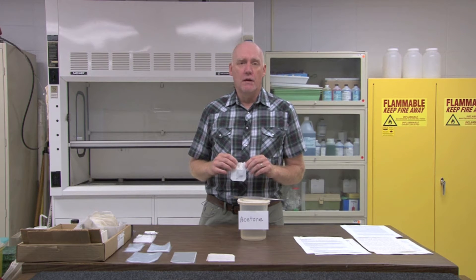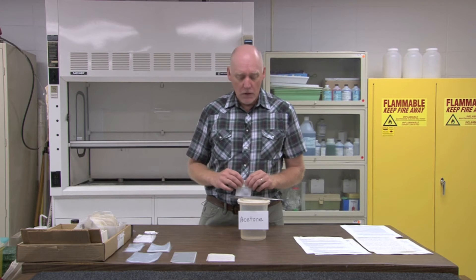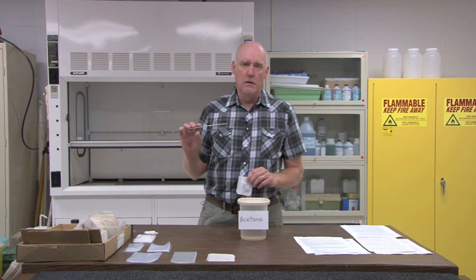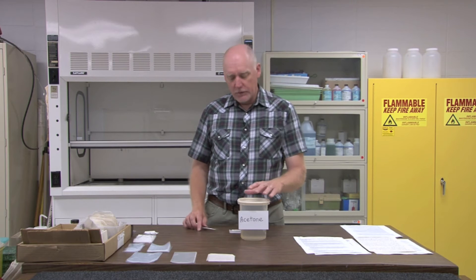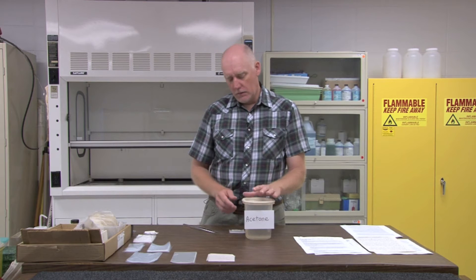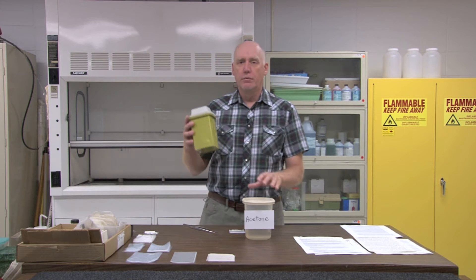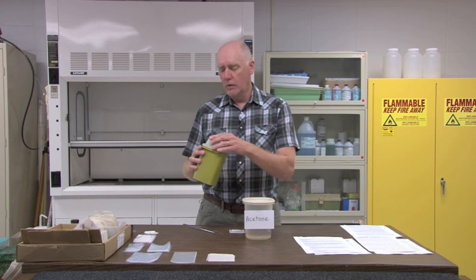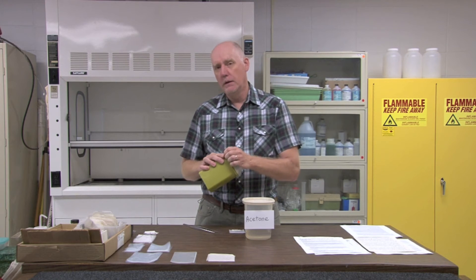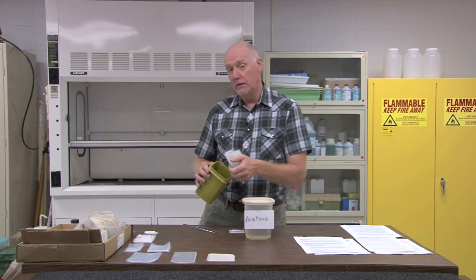However, I recommend that you use it in a well ventilated area and limit contact with your skin. I use a pair of long forceps to work with acetone. I pour the acetone into wide mouth containers like this Rubbermaid container. Pickled preservation jars like this also work very well as long as the opening has a mouth wide enough to take in the size of your envelopes.